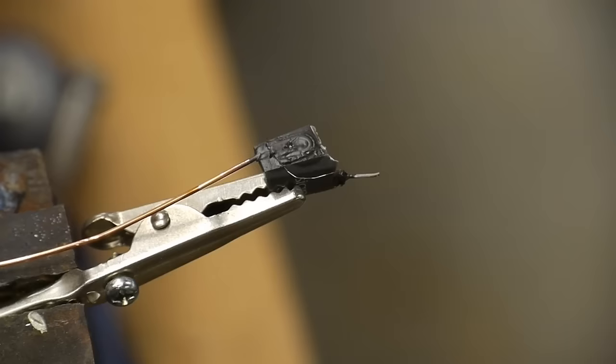So I added a tiny copper wire and then used conductive carbon glue to make sure that the stylus arm itself was grounded or at least electrically connected to everything else.